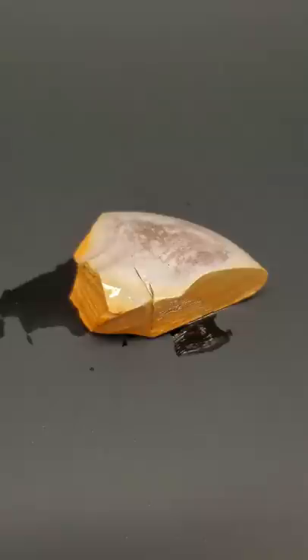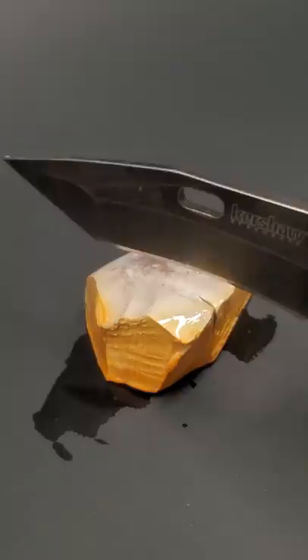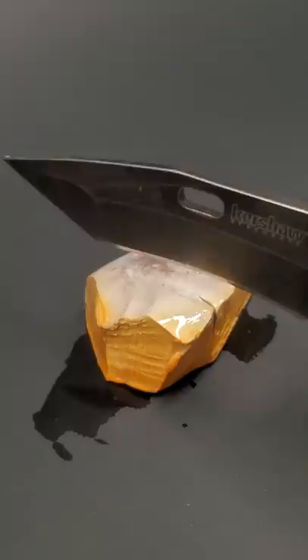Metals are usually shiny, and sodium metal is as well, but because it's so reactive, it quickly tarnishes. But because it's so soft, it can be easily cut with a knife, and on the inside, we can see the nice and shiny metal. After only like 10 seconds, it's already tarnished.